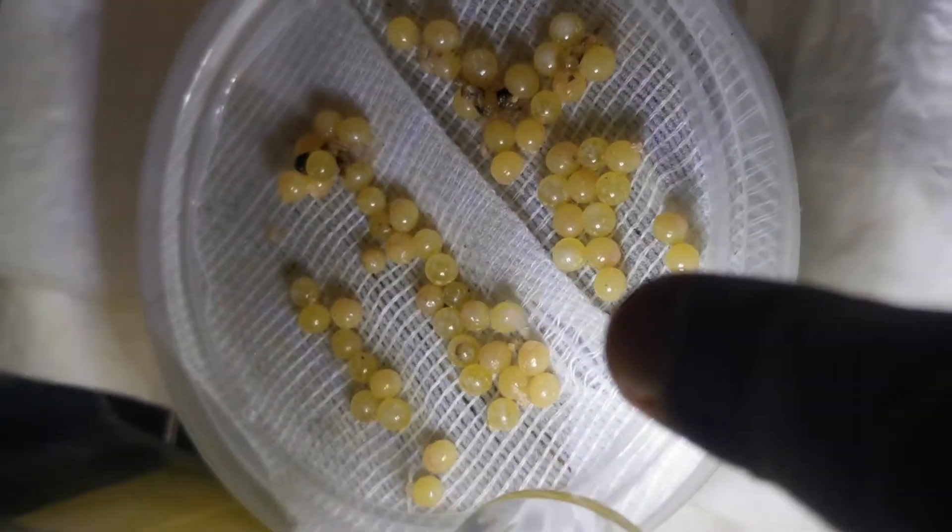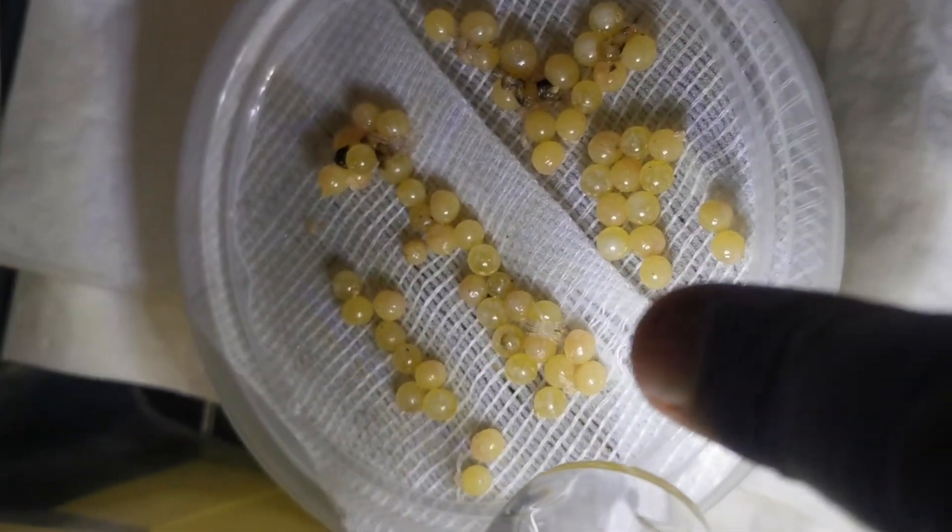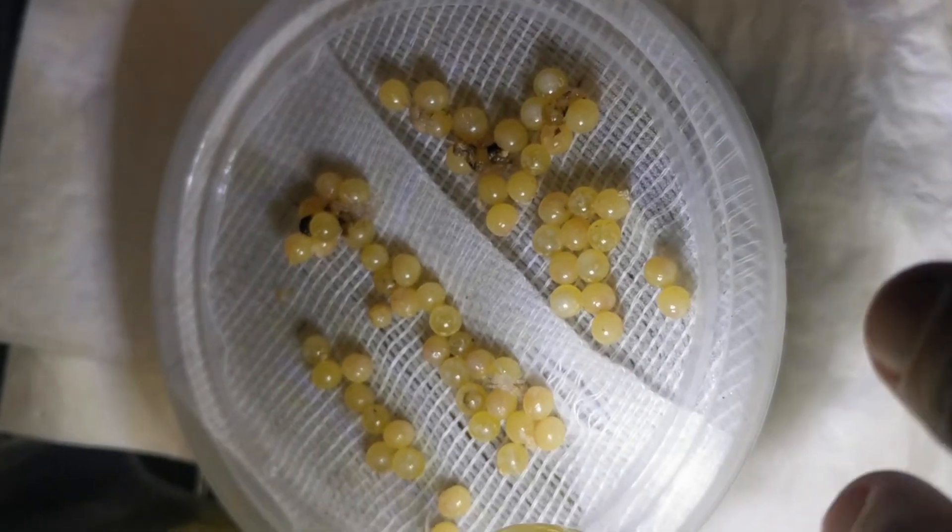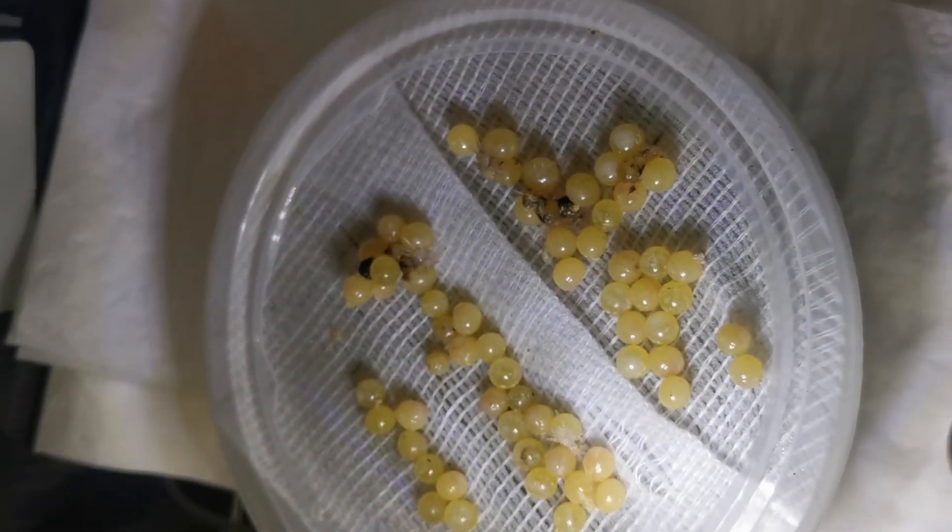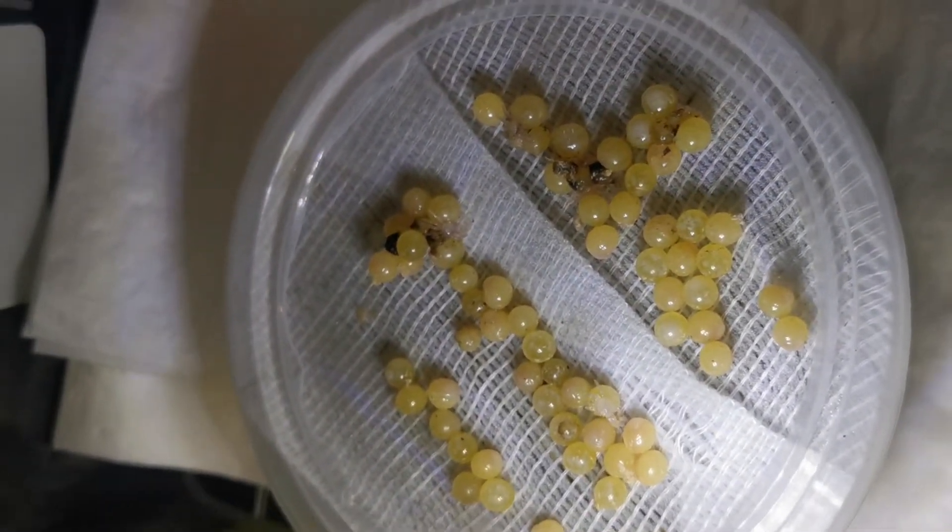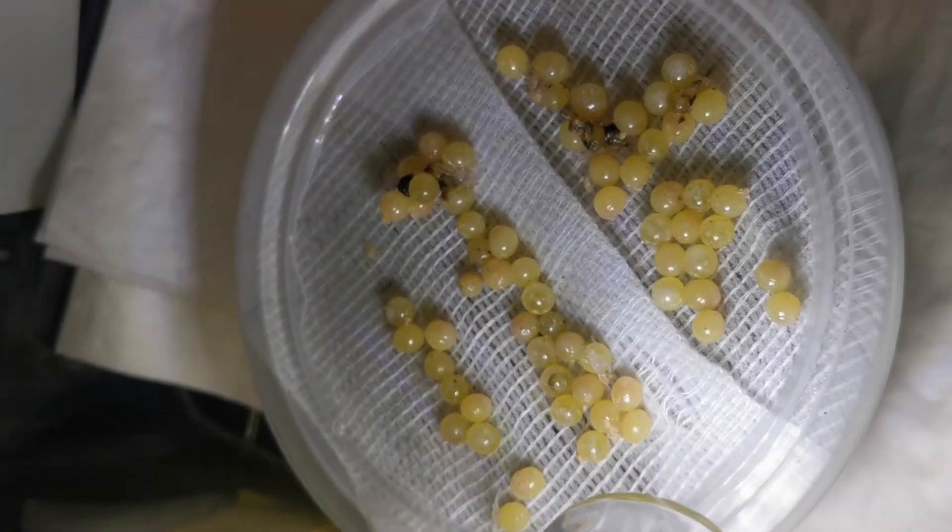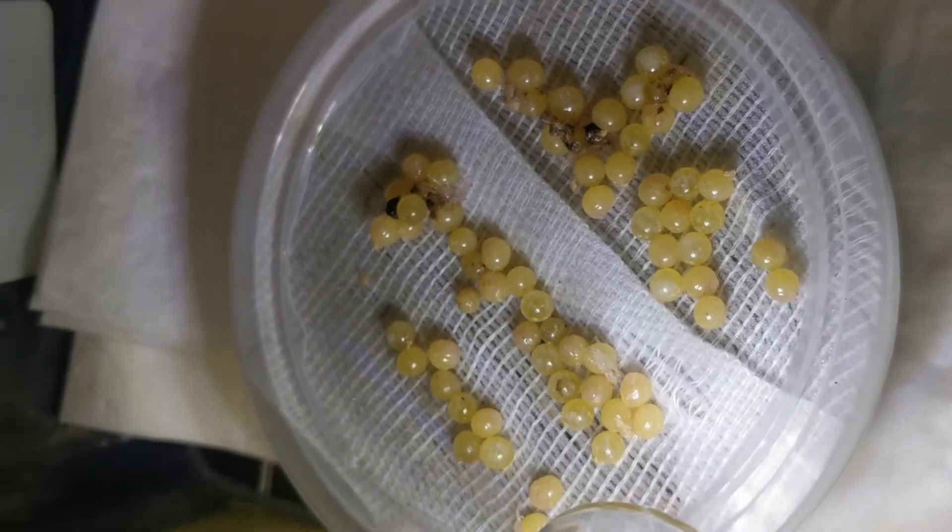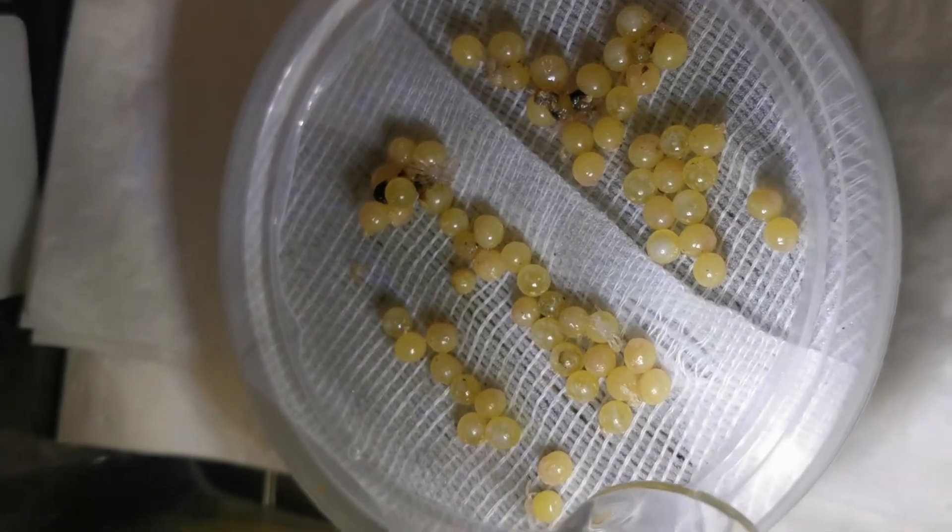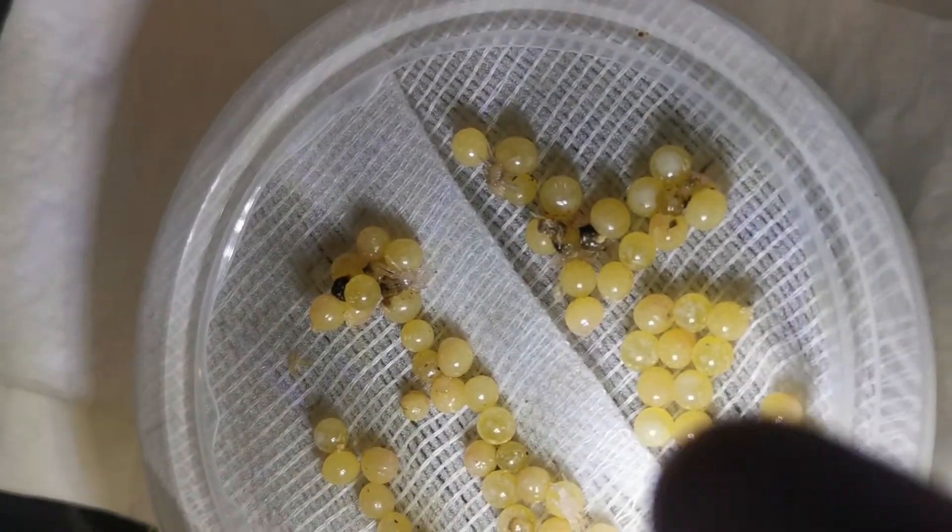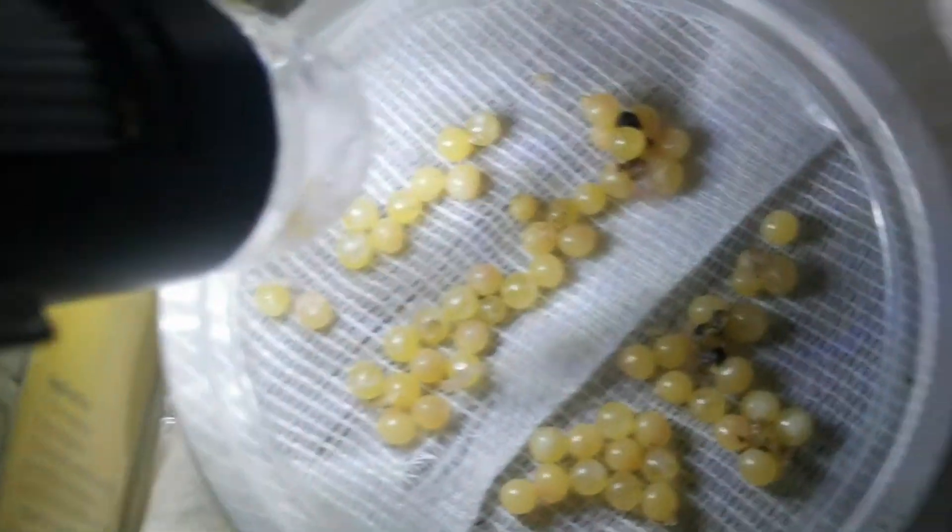So what I'm going to show you here is if you can just look at the bandage. You can see it's quite solid. Just focus it on the bandage. So that's our bandage and that's what you see on the microscope. It's not zoomed in fully.